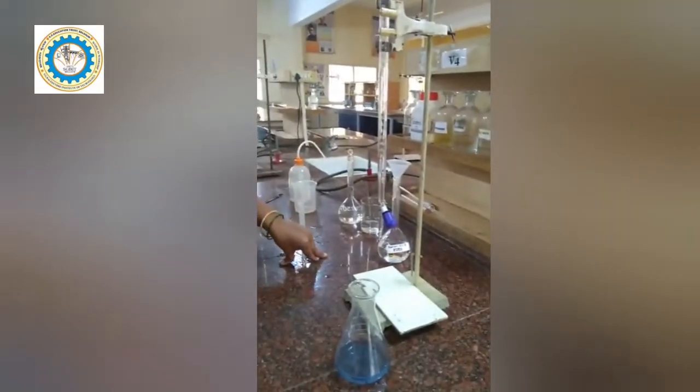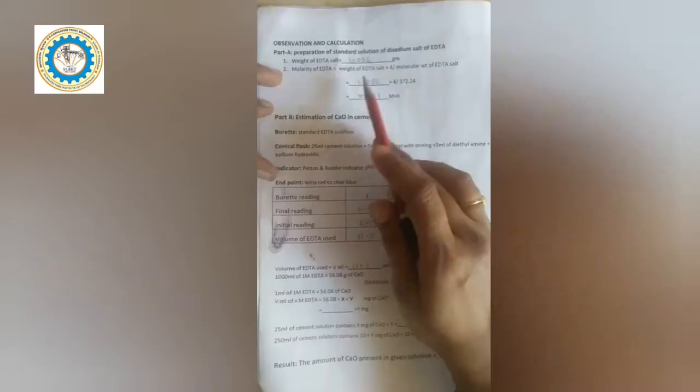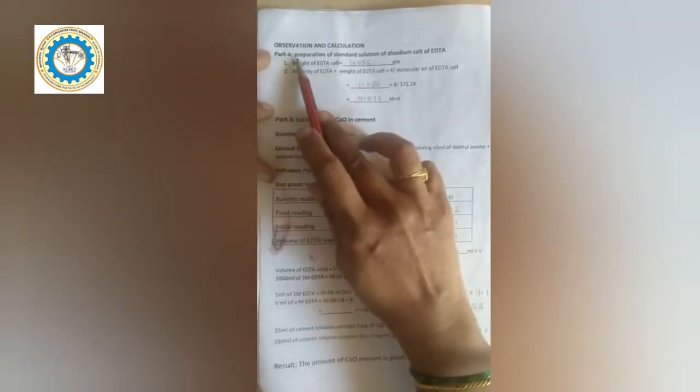Similarly, we need to pipette out two more samples and find out the reading. Once we get a concordant reading, we go for the calculation. I will show you how to do the calculation. Now let us see the calculation.